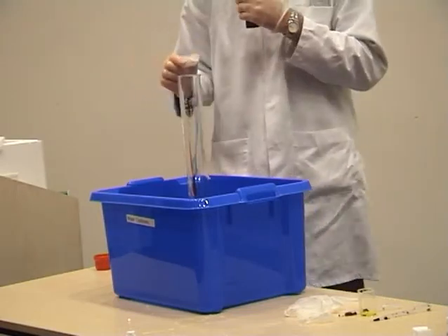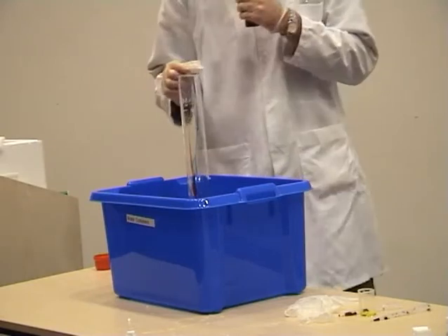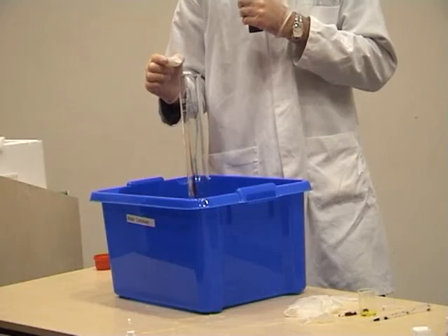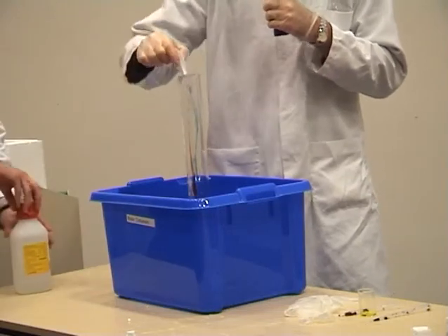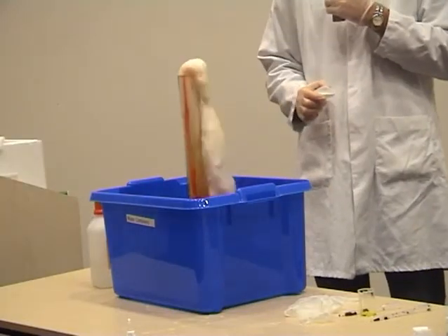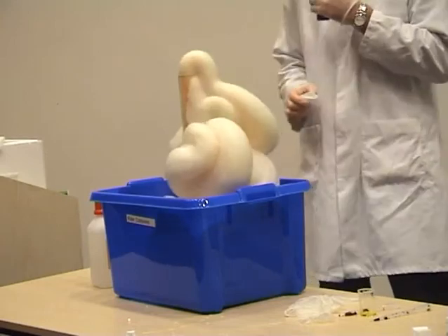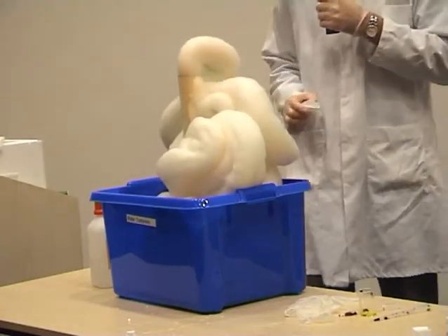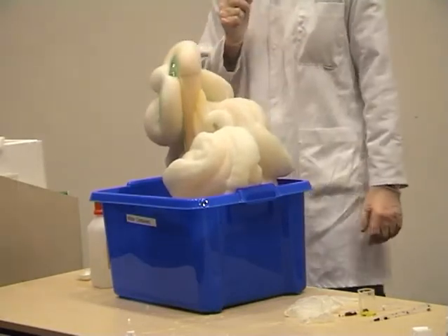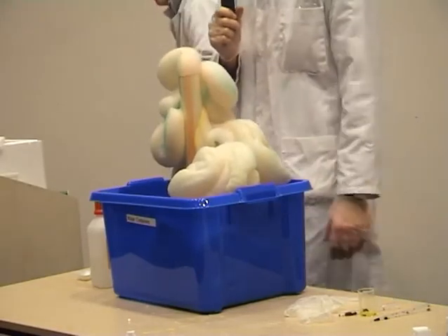Okay guys, I wasn't happy with that countdown, so can we have another countdown? 5, 4, 3, 2, 1. Okay, so there you have it, that's oxygen release.